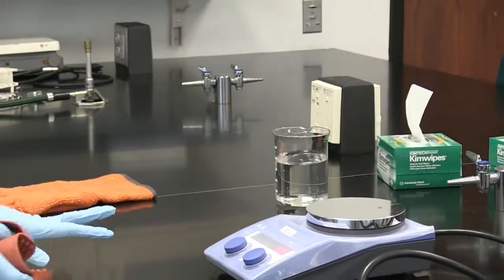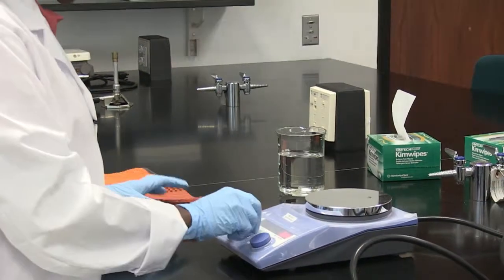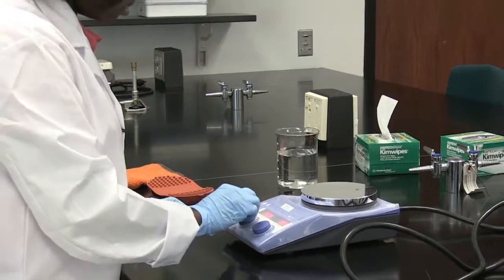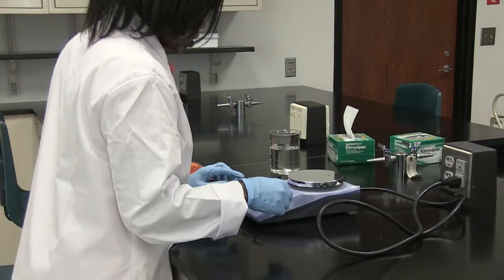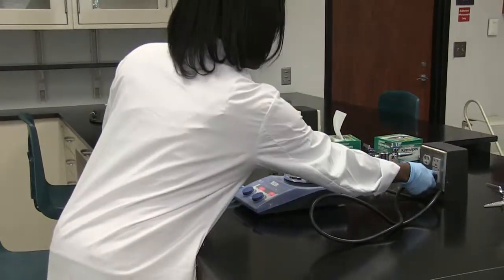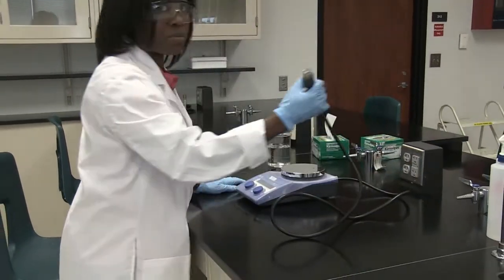I'm finished with the hot plate now, so I turn it off and then make sure I unplug the equipment.